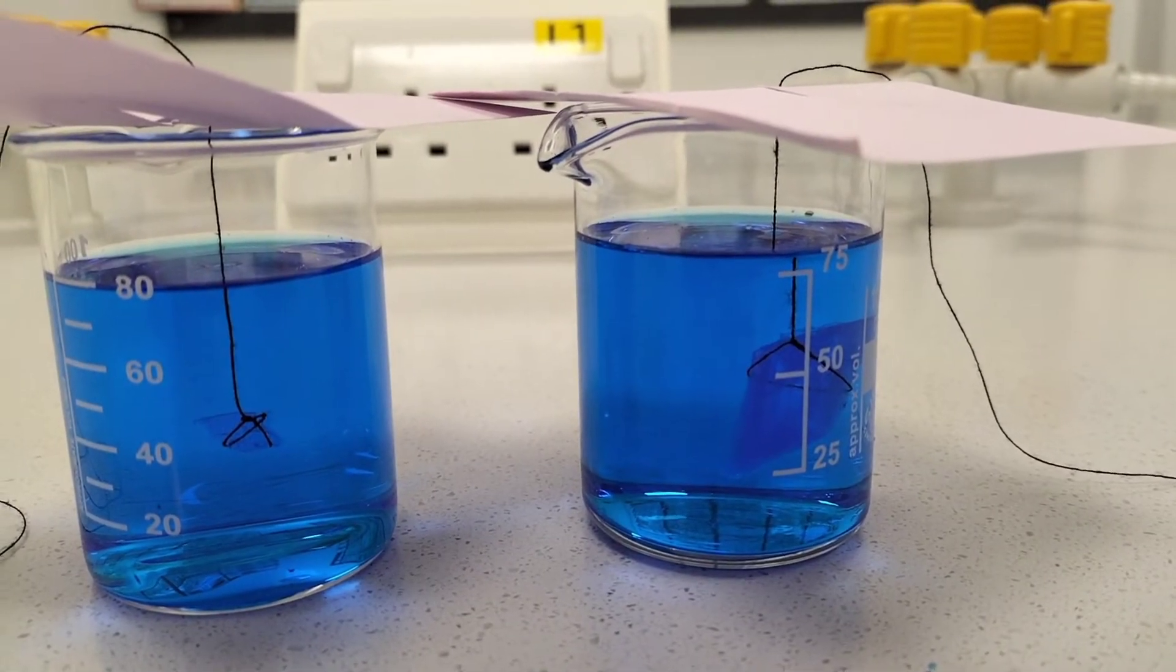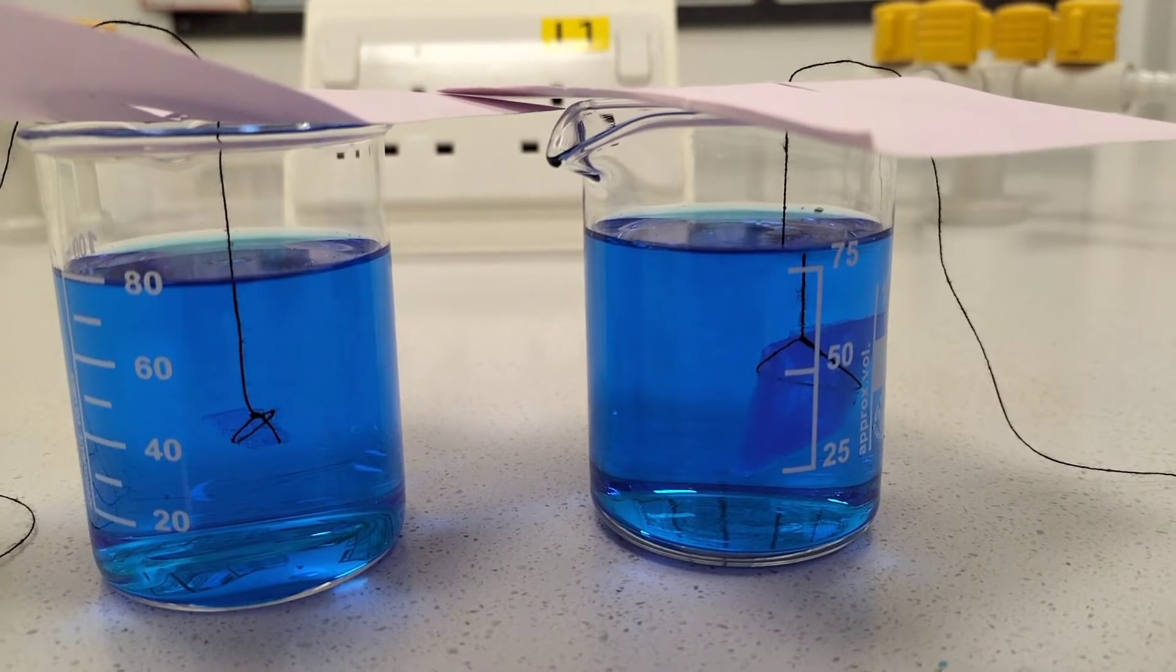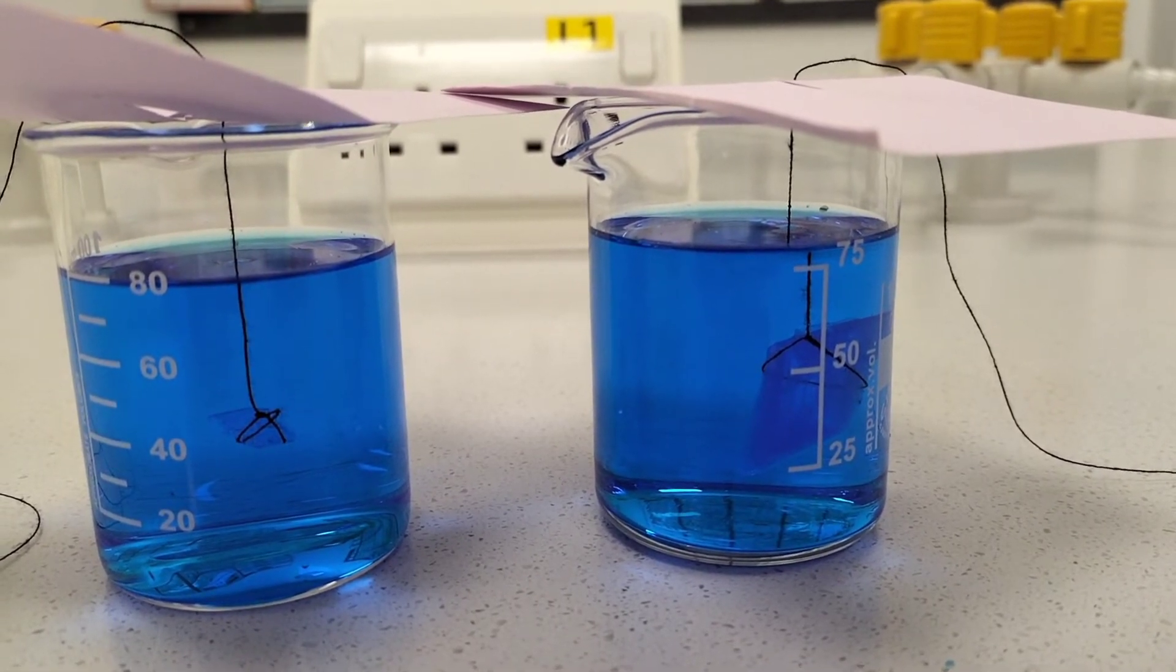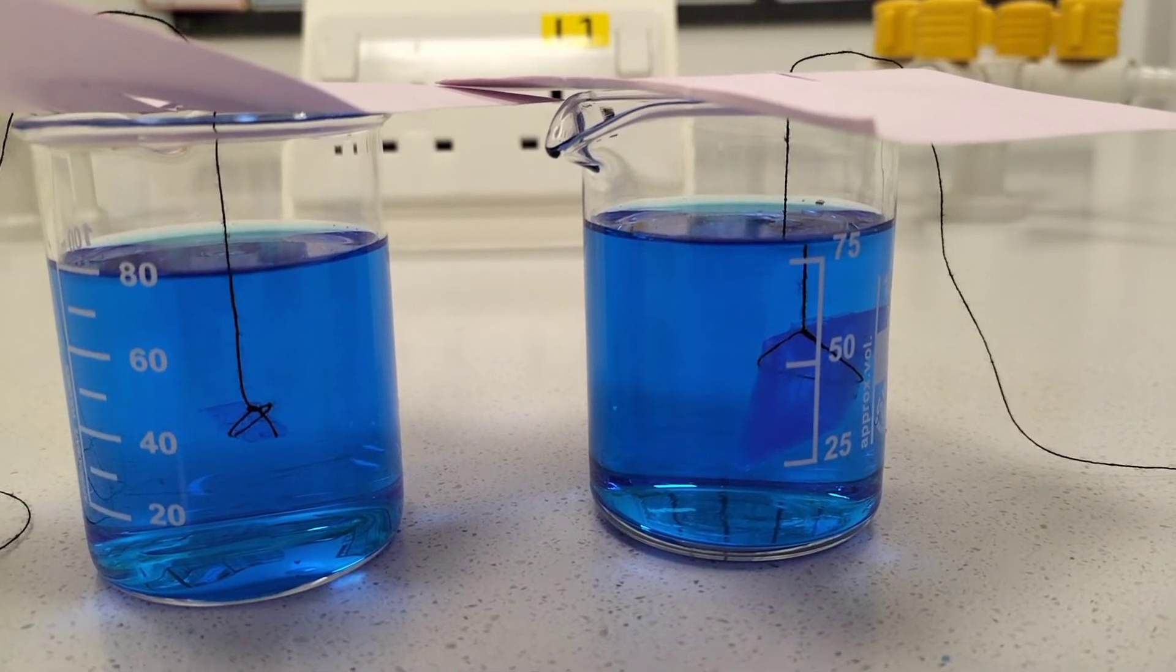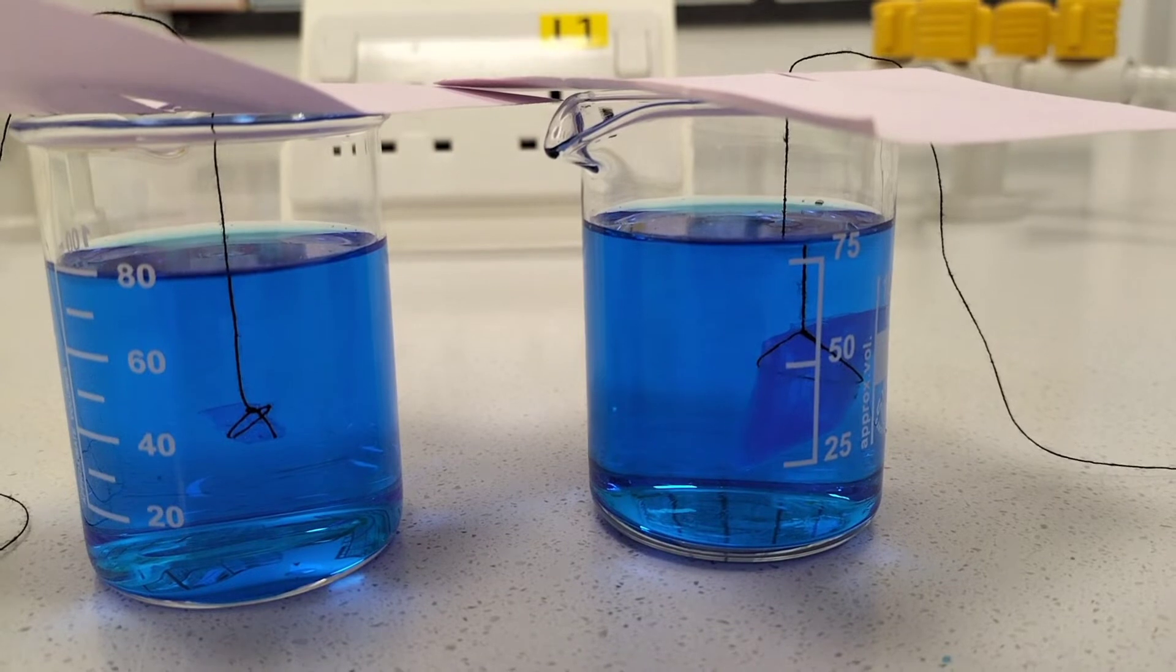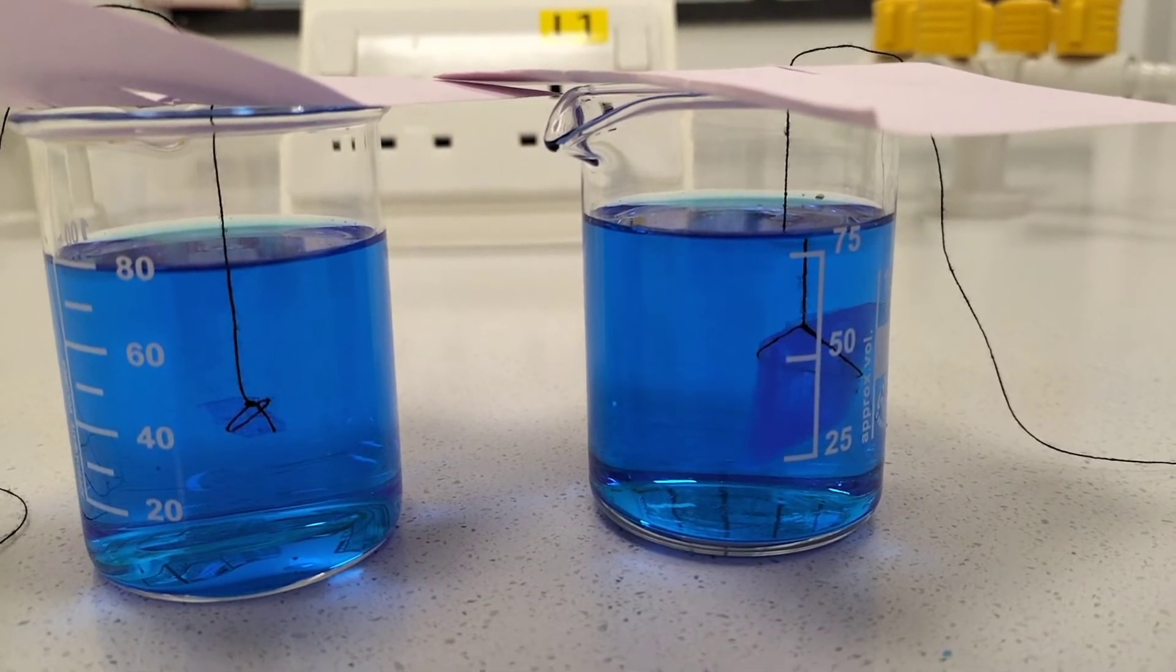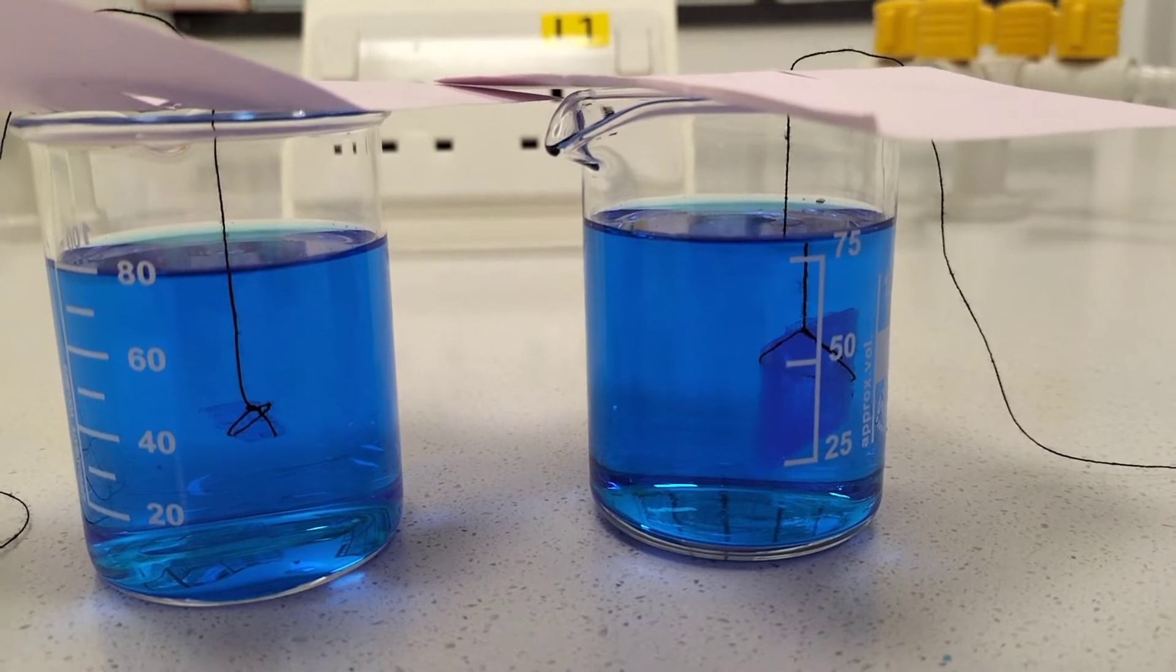Now we have both crystals floating gently in our deep blue copper sulfate solution. I'm going to leave these for a long period of time, possibly a number of months, and grow them as large as possible. Occasionally I'll update the video with the progression, and at the end of that time period we'll see just how big we can grow these crystals.